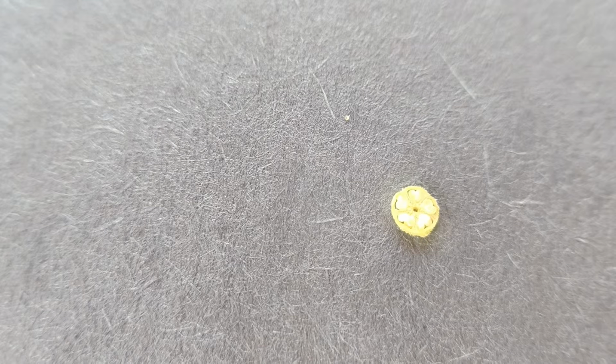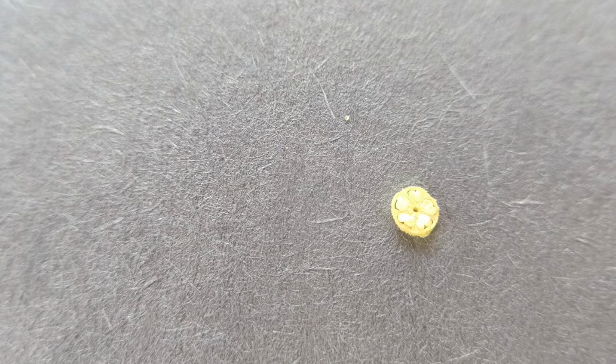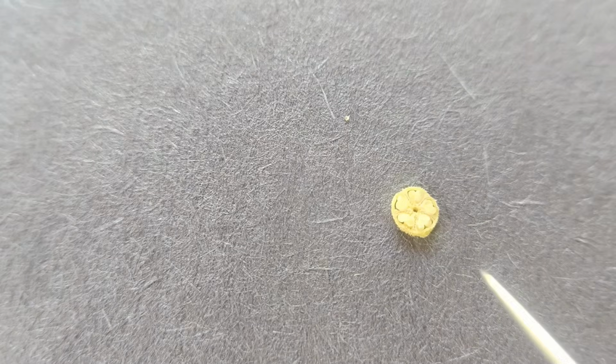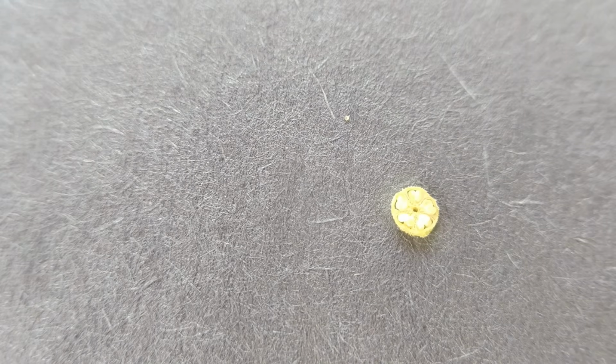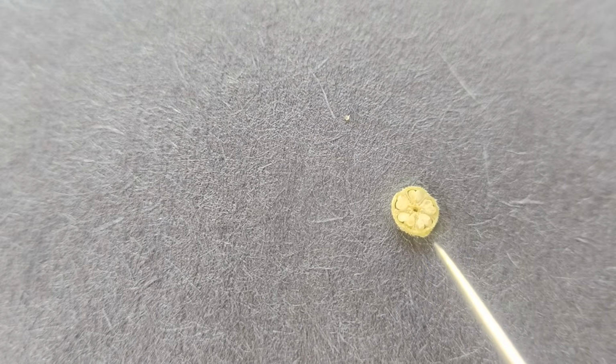So the ovary in Hibiscus rosa sinensis is, because of 5 carpel, it is pentacarpellary. All carpels are fused, so ovary is syncarpous. Ovary is superior because calyx, corolla and staminal tube are present below the ovary. Because of presence of 5 locules, that is chamber, the ovary is pentalocular and each locule consists of ovule. Here these tiny structures are ovule.